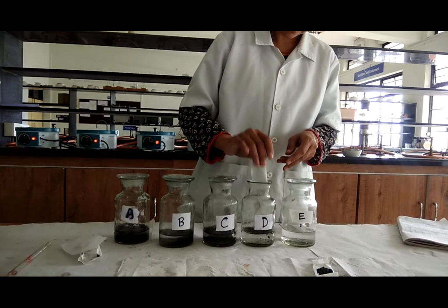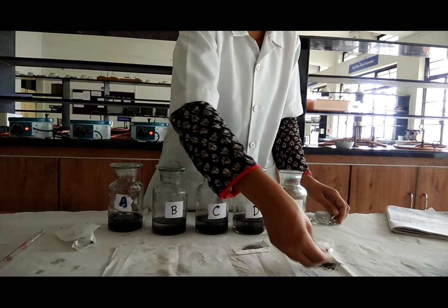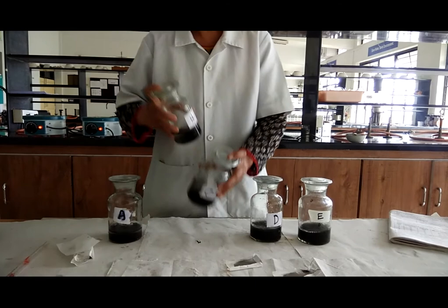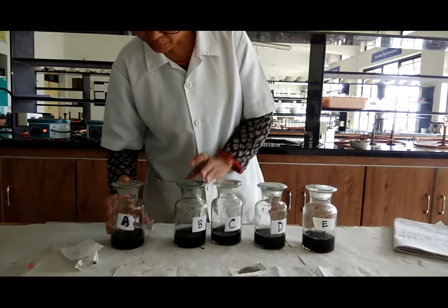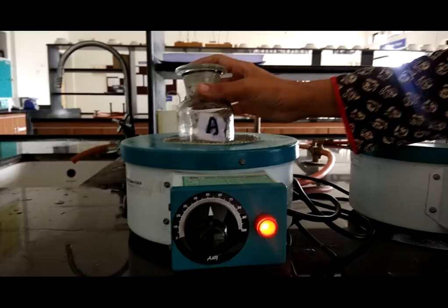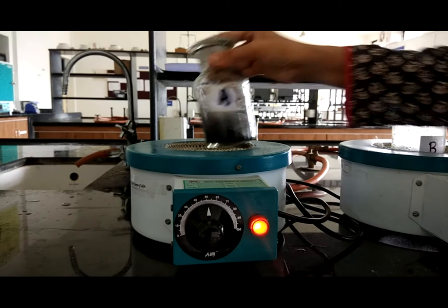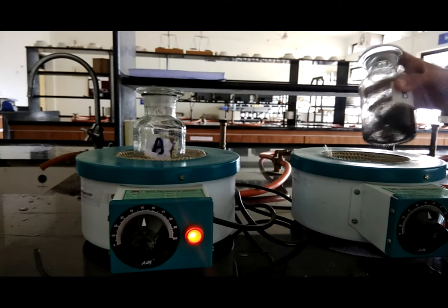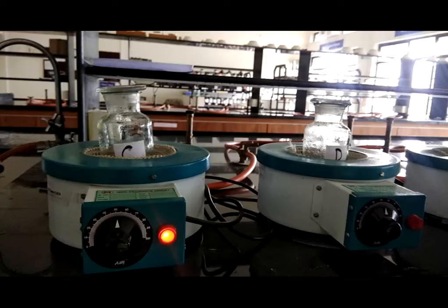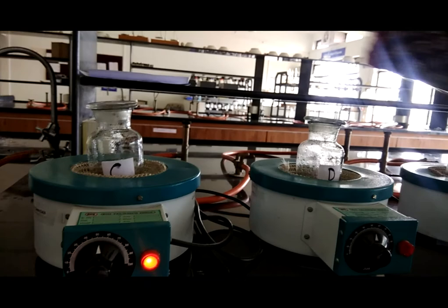After adding the charcoal to each bottle, shake the bottles well. You have to maintain a constant temperature by keeping the bottles on a heating mantle or water bath, and then titrate after heating. I am putting the bottles into the heating mantle, maintaining a constant temperature of 50 degrees centigrade. During this heating process, shake the reagent bottles occasionally. Likewise, put all bottles — including D and E — into the heating mantle.